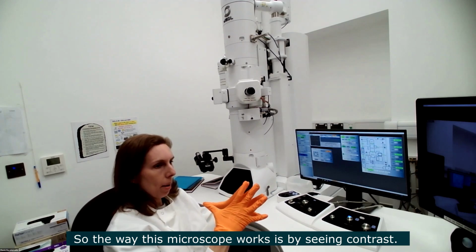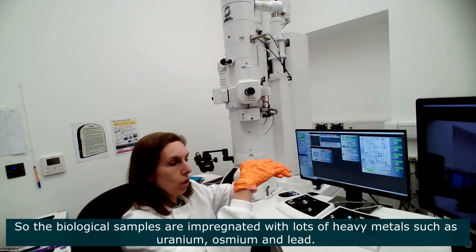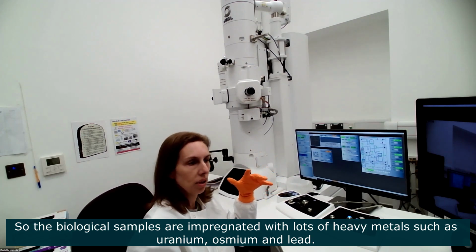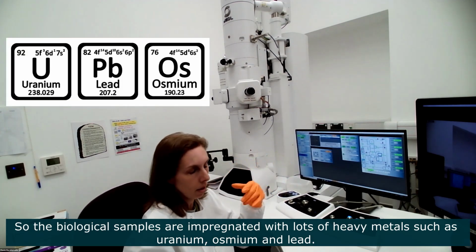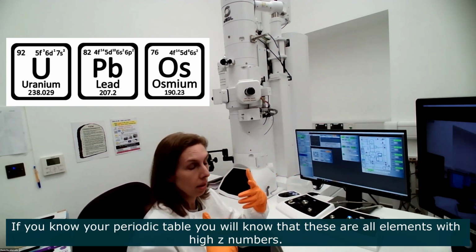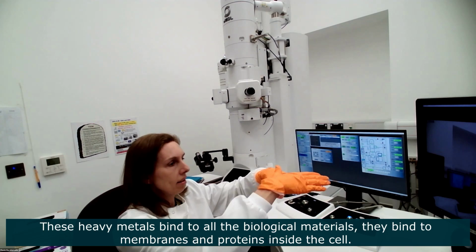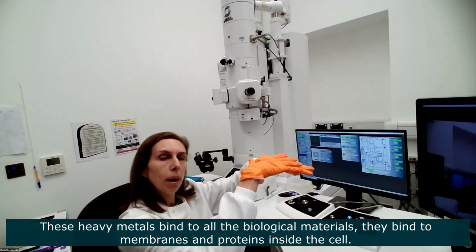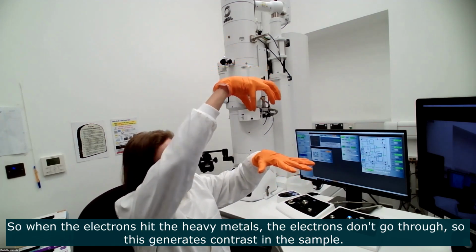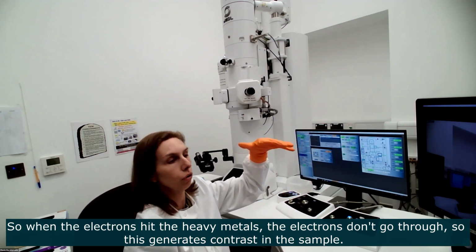So what happens in this microscope, the way it works, is by contrast. Your sample will be impregnated with lots of heavy metals. We use heavy metals like uranium, osmium, lead. If you know your periodic table, you'll see that these are all elements with high Z numbers, very heavy metals. These heavy metals bind to all of the biological material, to membranes and things inside the cell. When the electron beam hits them, the electrons don't go through where the heavy metals are. So this generates contrast.